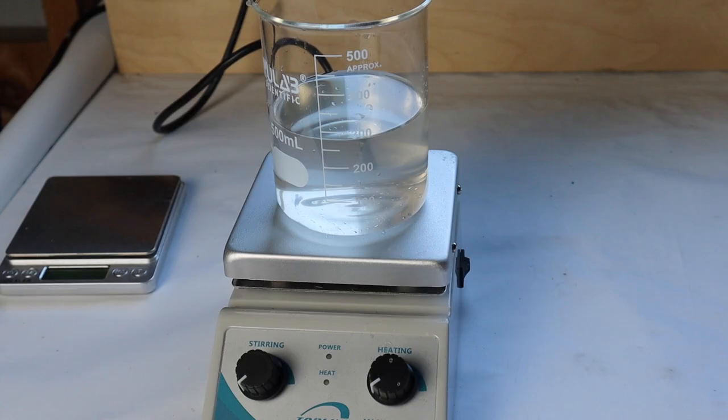After a long and tedious filtration process, I got a mostly clear liquid. It's still a little bit cloudy but then again I'm using the ashes from Tums to make this. Now I'm just going to try and evaporate most of it away with the hot plate stirrer.